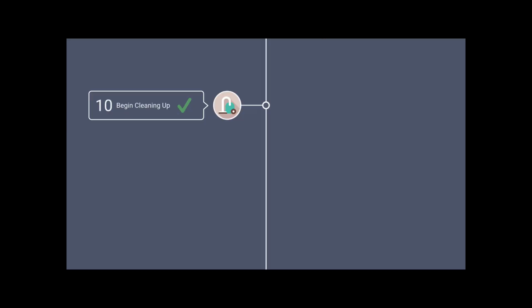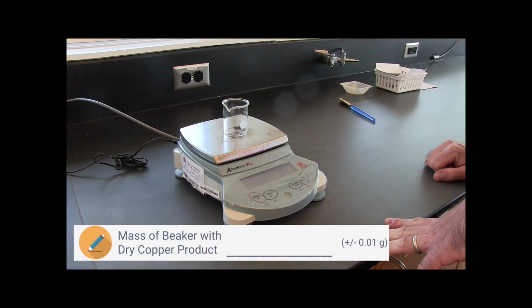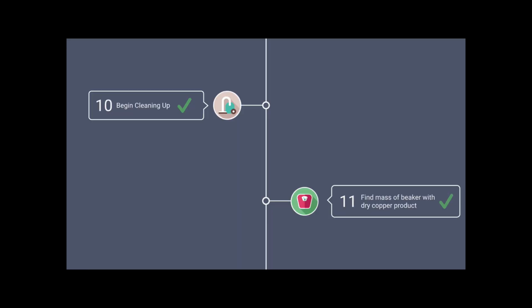After 5 minutes, your copper should be dry. Remove the beaker from the hot plate. Don't worry, you can use your hands. The top of the beaker isn't that hot. And using the balance, find the mass of the beaker with the dry solid copper product.